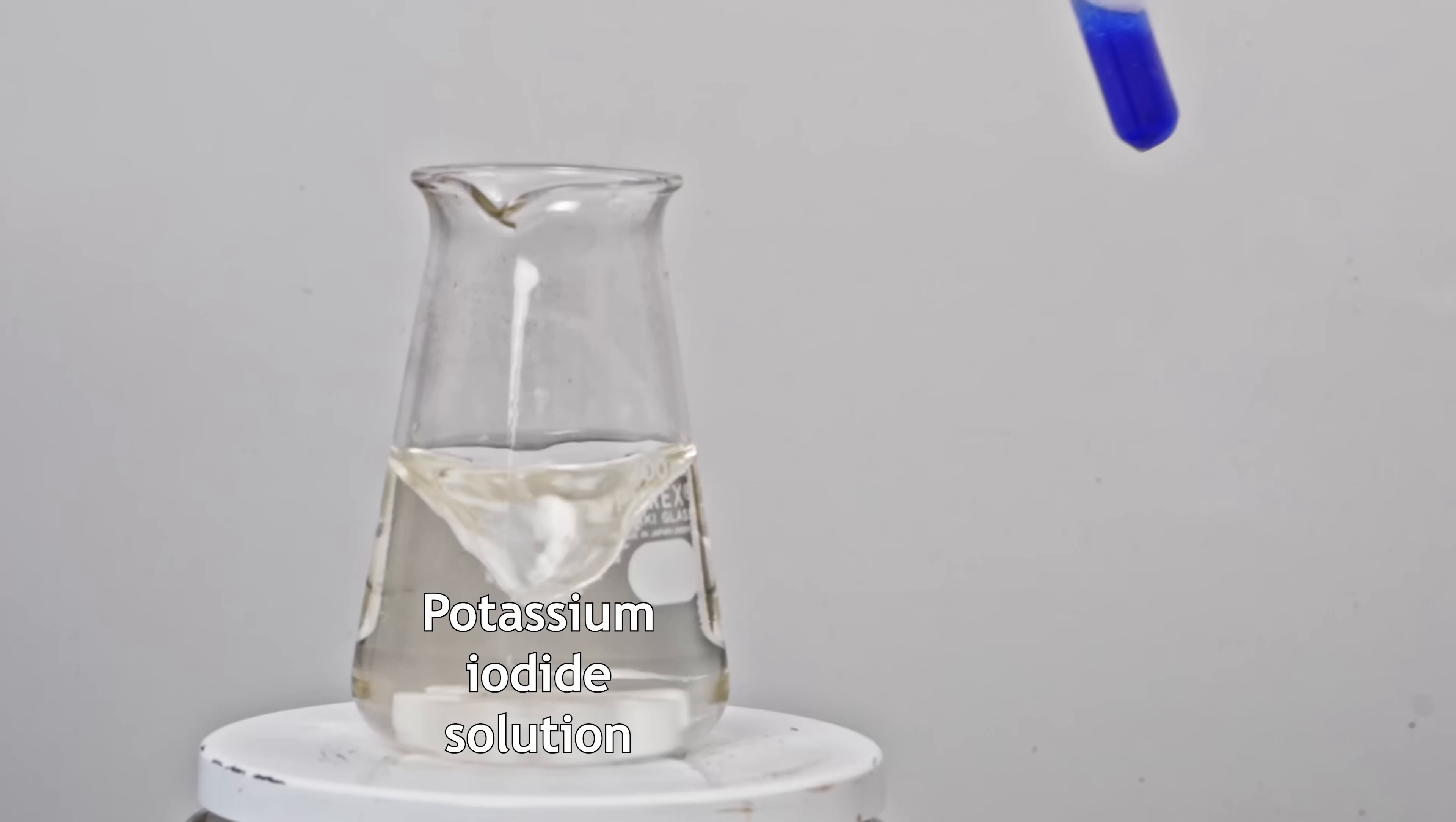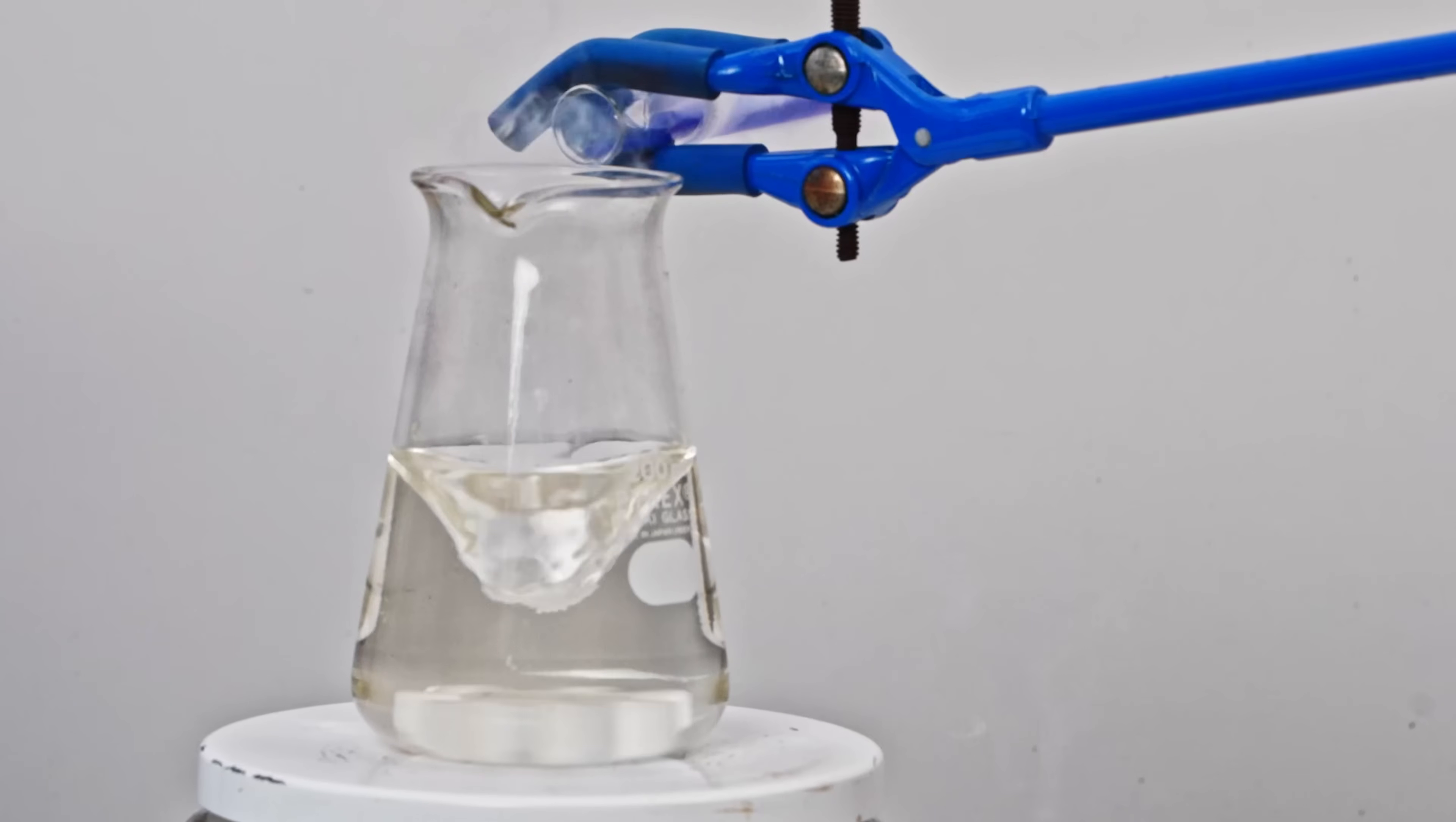Before moving to more explosive reactions, let's look at a few safer ones. First, the classic reaction with potassium iodide solution.